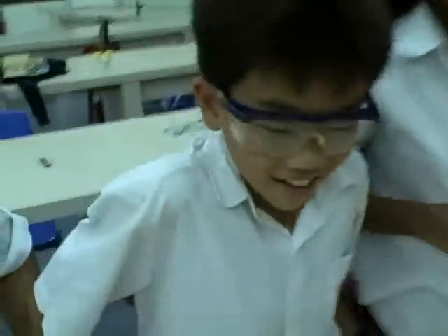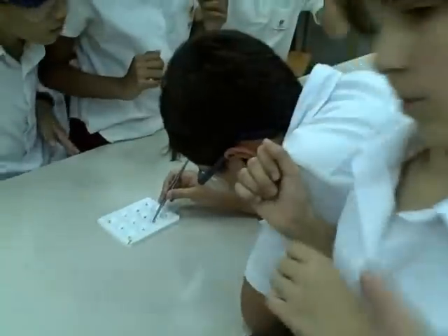Hi! Okay, today we're going to put sodium pieces in lemon, okay? First person, please. Be careful, okay? All right, move away. Matilda, with your goggles.